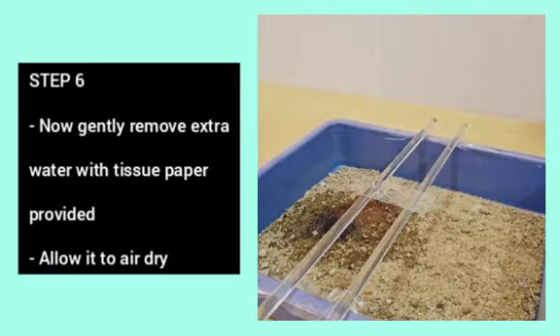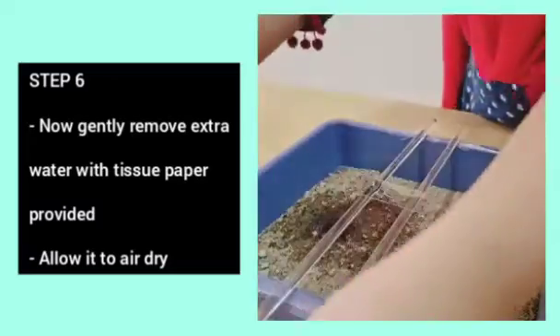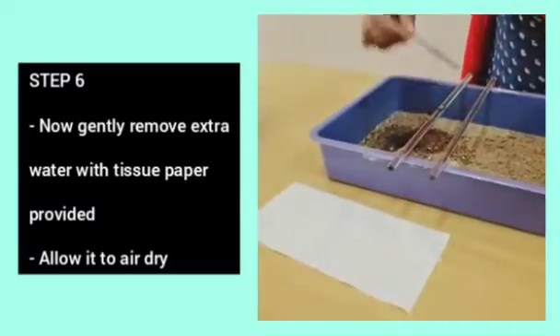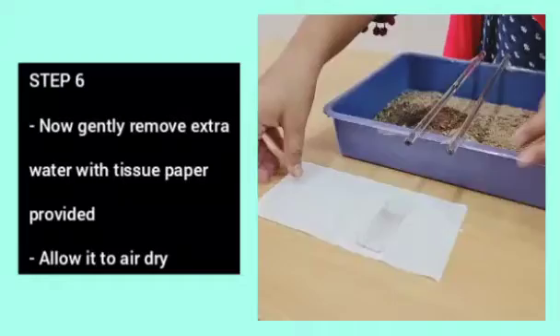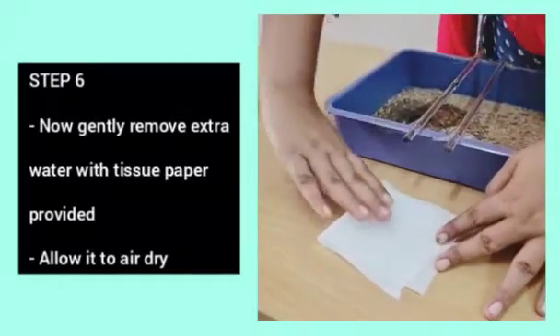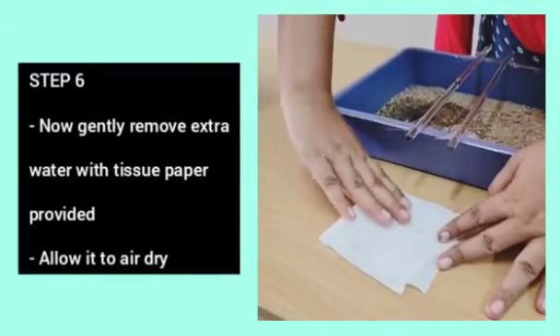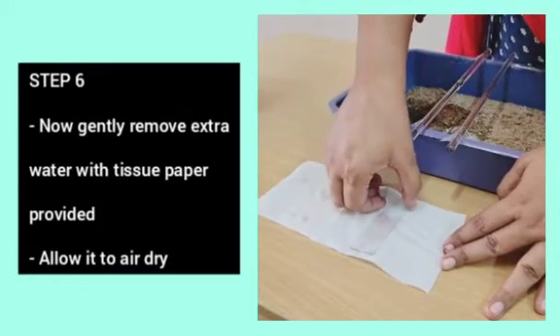Step 6. Now, gently remove the extra water with tissue paper provided. Allow it to air dry.